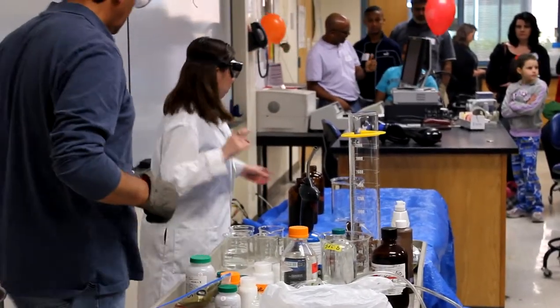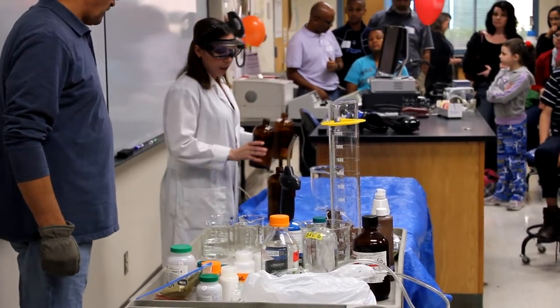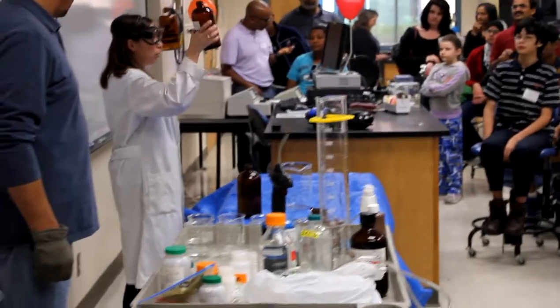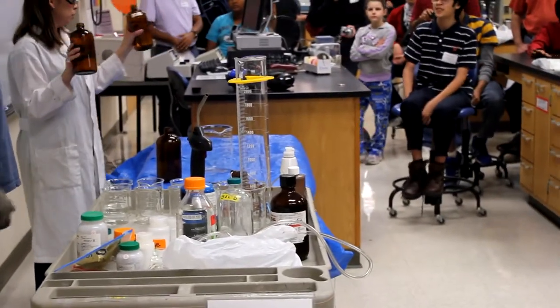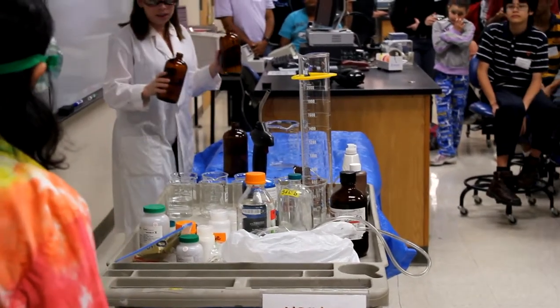So what we're going to do for you guys is an oscillating reaction. We're going to pour at the same time for these three solutions, and you'll see as we pour that there are three clear, colorless solutions. I want you guys to take a look and see what's going to happen.